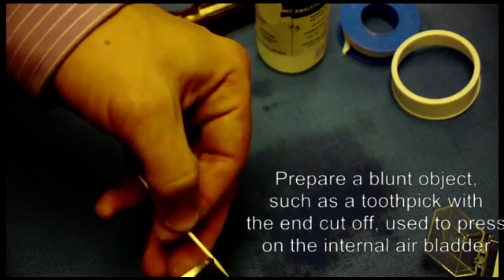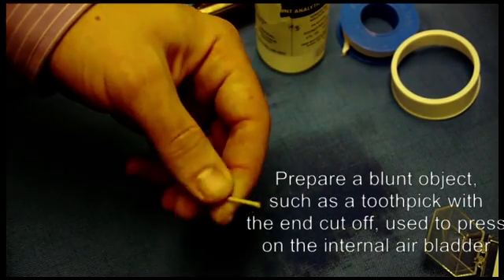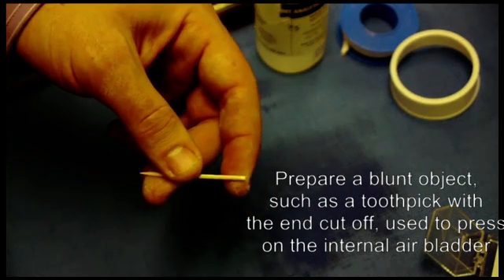Next you want to get a toothpick and snip the end of it so it has a blunt end that you can use to press the air bladder in the cathode.